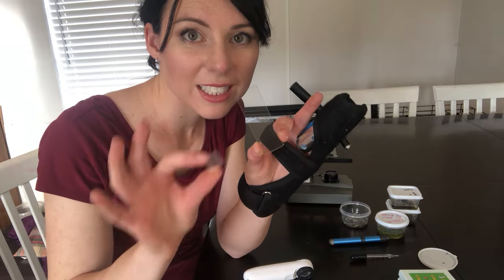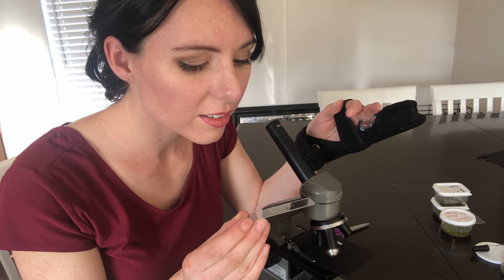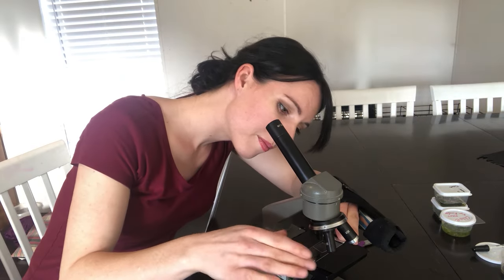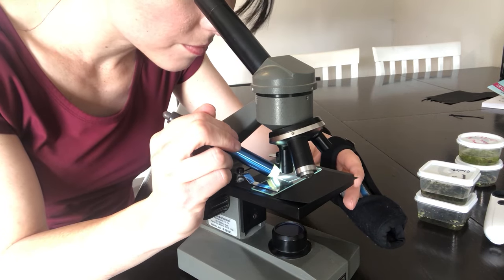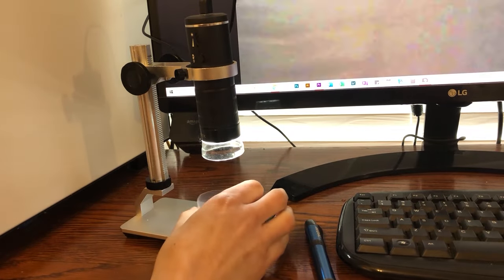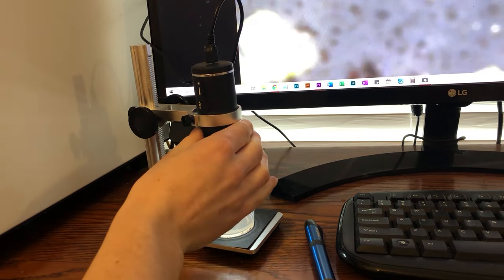I had to find my tardigrade first. My little slides were completely transparent and impossible to see. So here's the specimen I'm going to try to look for a tardigrade on, but again — too high a magnification. It took absolutely forever, so I had to go back to my observation microscope. I'm going to try the black piece of paper dark field technique on the observation microscope instead, and I'm telling you, this was the key to success. This was the big difference. This was amazing.